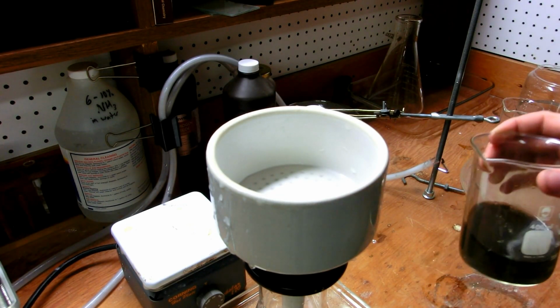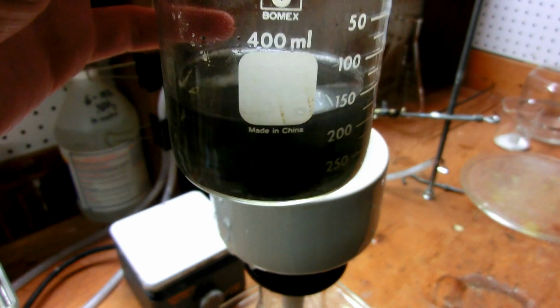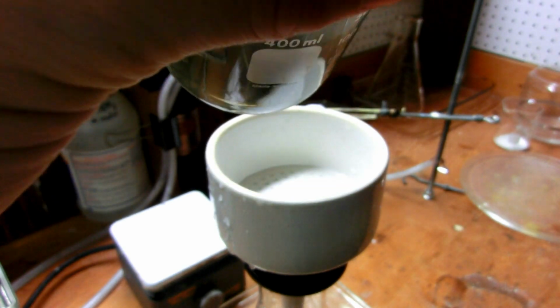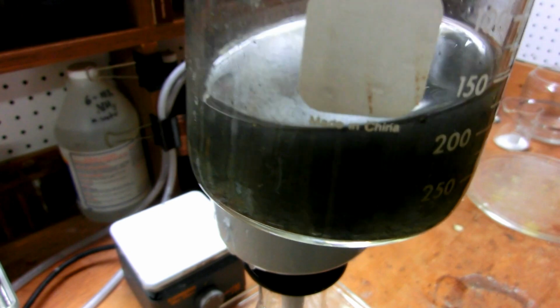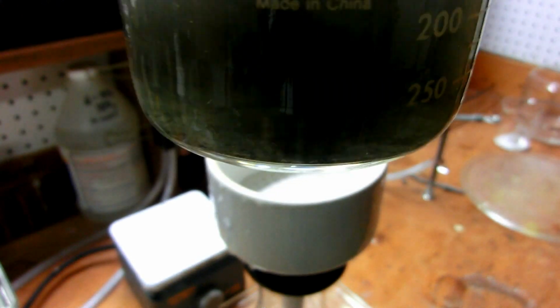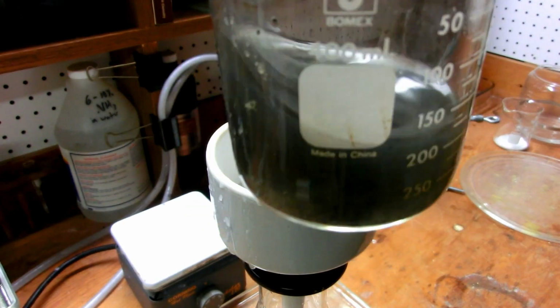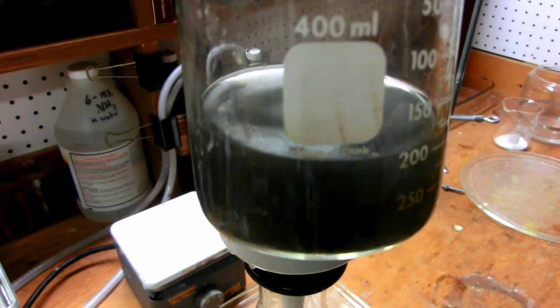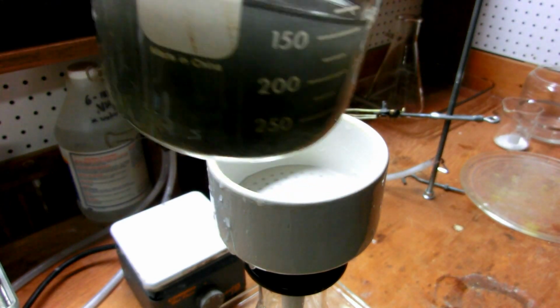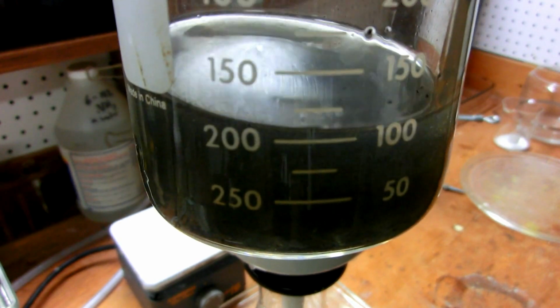Alright, so here we have the solution of now ferrous chloride and a little bit of excess HCl. And I've added some water to it to dilute things down a little bit so you can kind of see it. But anyway, you can see it's kind of a black sludgy material because that's suspended carbon, because obviously the steel wool is not pure iron, it's steel, and steel is iron and carbon. And since we've dissolved away all the iron, what's left is a very fine suspension of carbon particles. And this will be filtered out to leave us with a green solution of ferrous chloride.